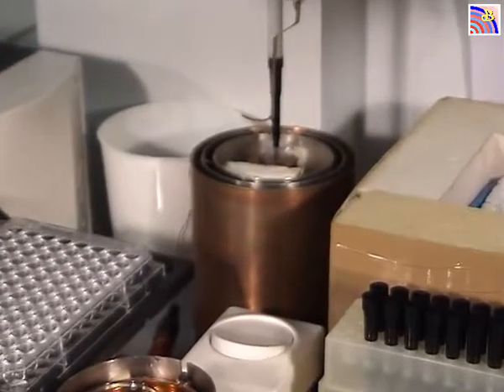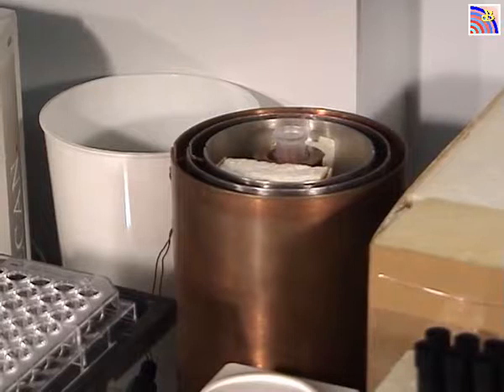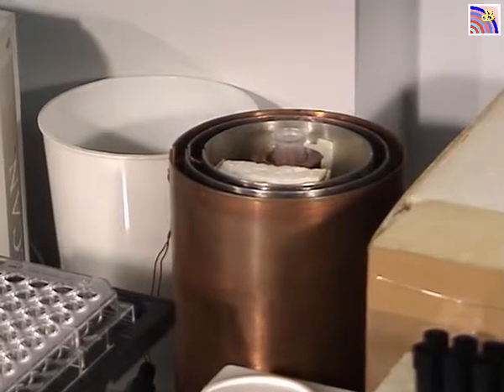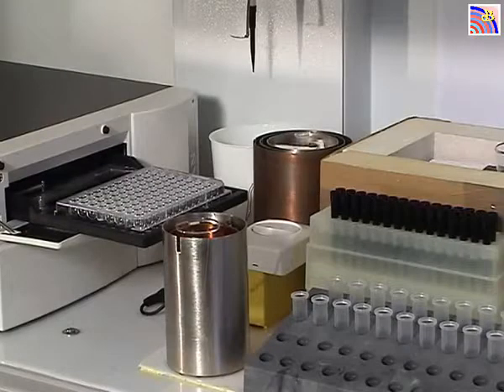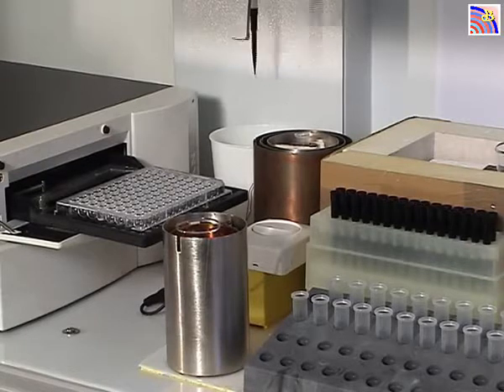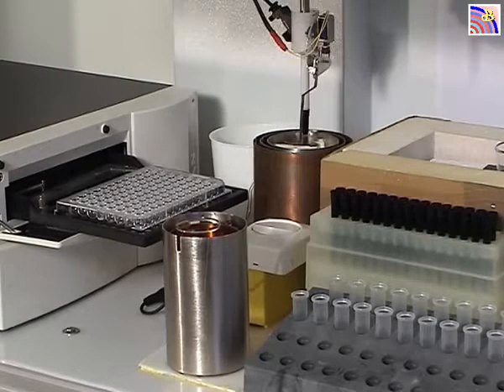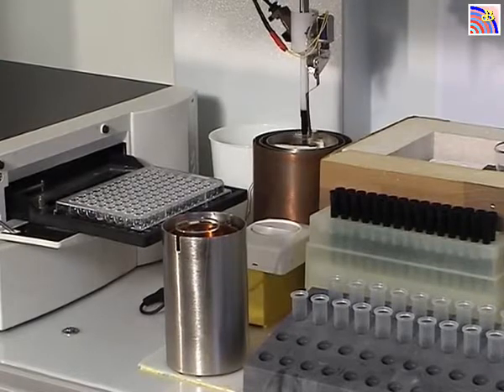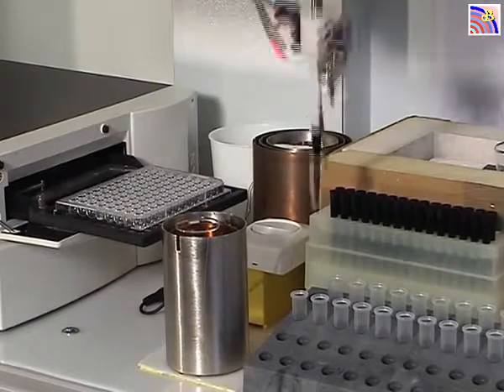And then during 5 minutes, this tube will be submitted to the signal. We have obviously skipped the 5 minutes. And the machine will now take another tip, get this tube with the informed water and put it back in place.